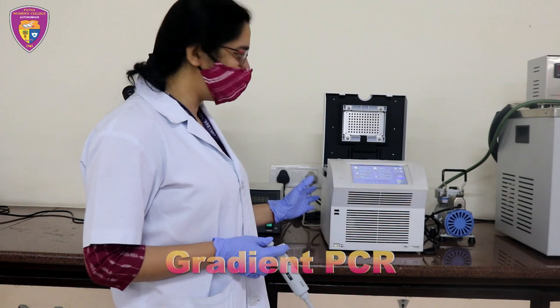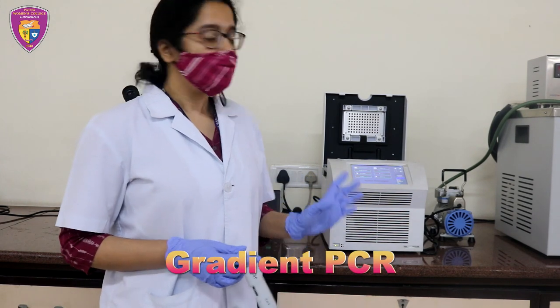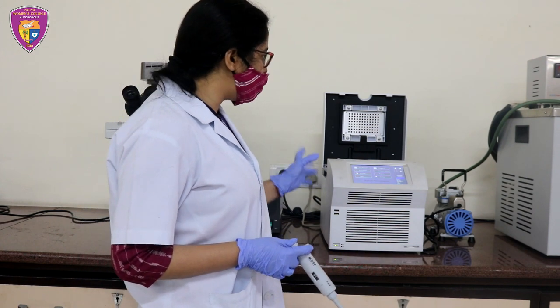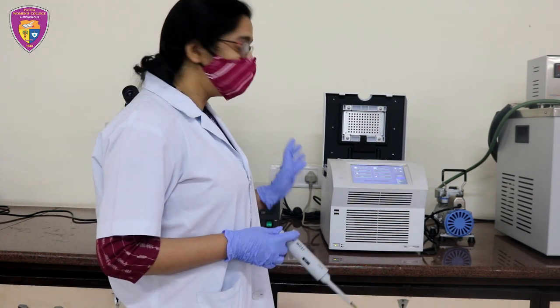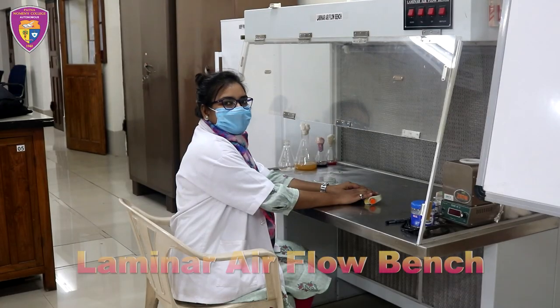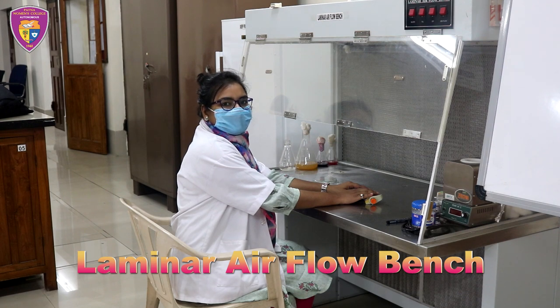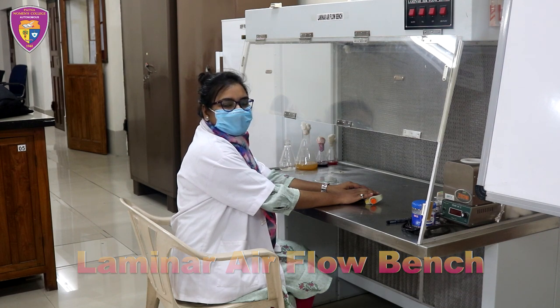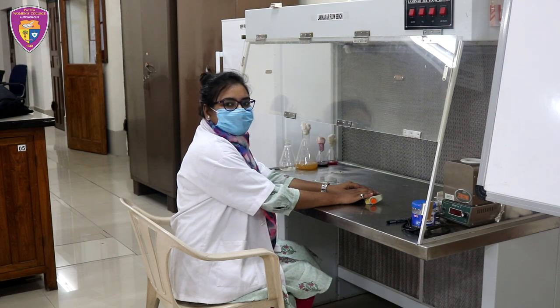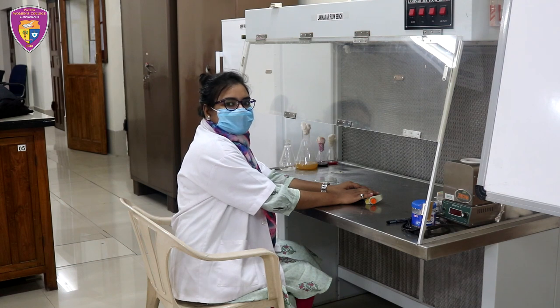This is a gradient PCR. It differs from the conventional PCR. It optimizes the PCR reaction by determining the exact annealing temperature. This equipment is laminar airflow and it is used for creating a contamination-free environment through installed HEPA filters and is also used for transferring bacterial cultures under aseptic conditions.